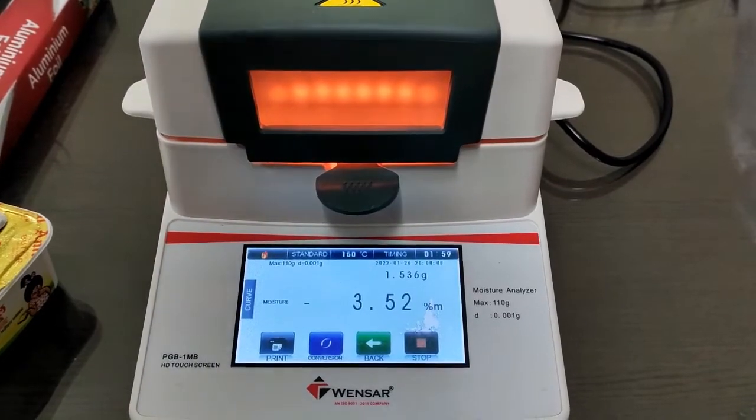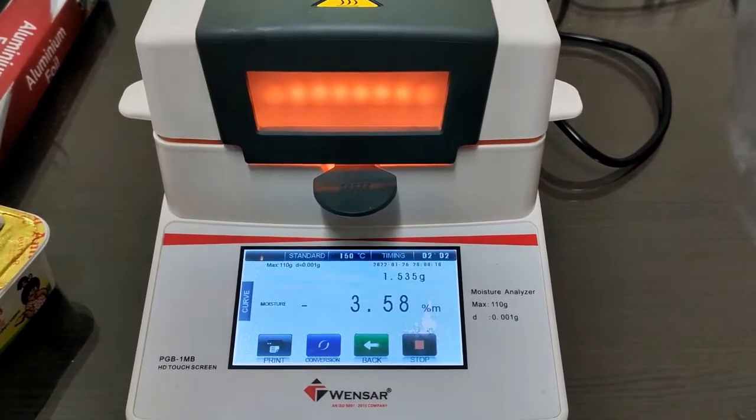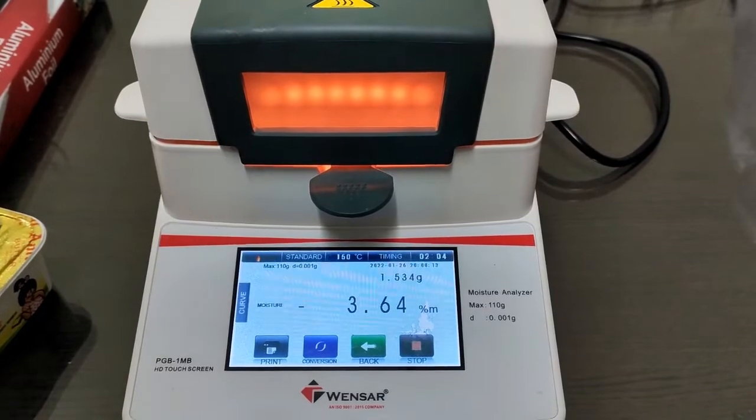You can see now it is already 2 minutes, so 1 minute left.